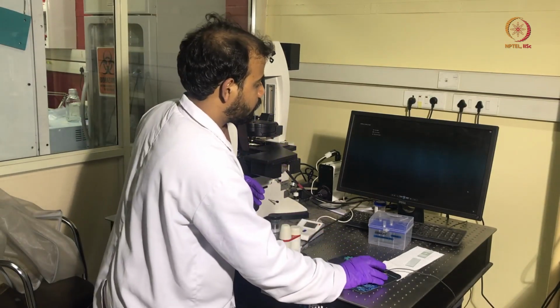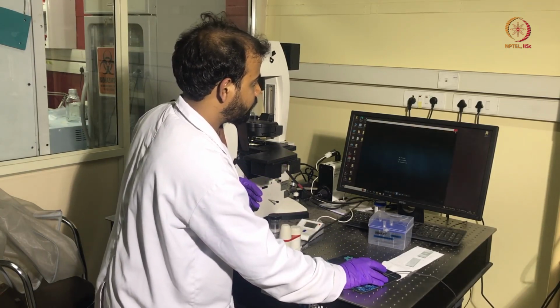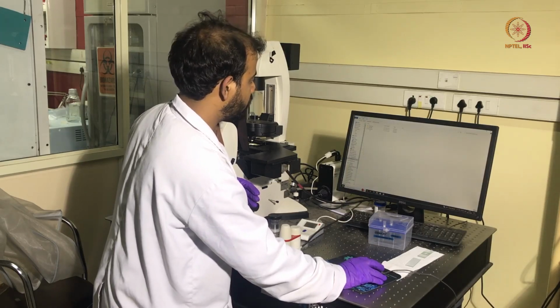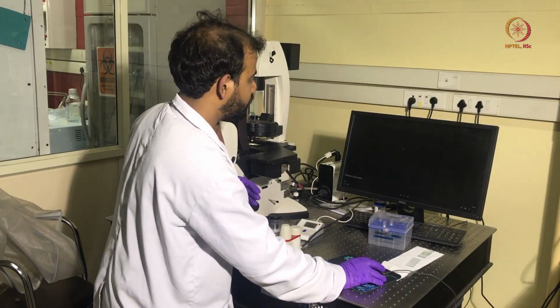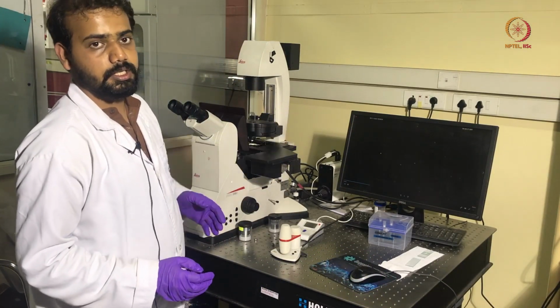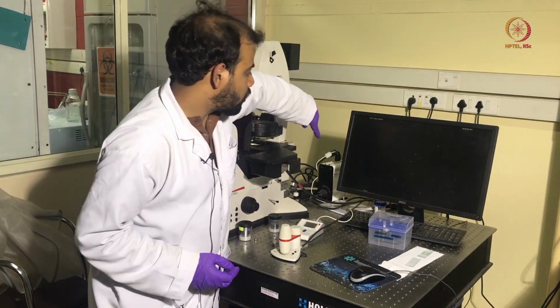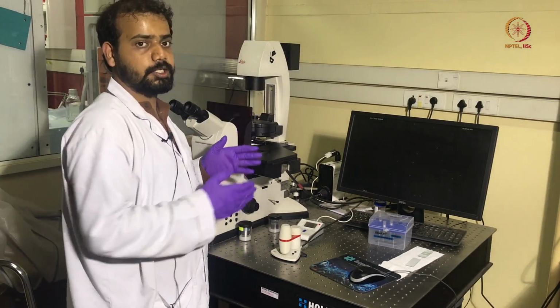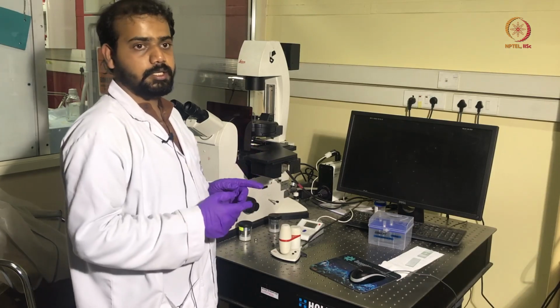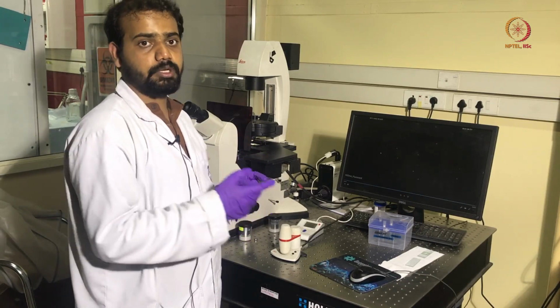And now we will move towards the third technique, which is fluorescence microscopy. Here again the white dots are the Brownian particles. In fluorescence microscopy, this is the white light source which we will turn on, and we will allow the white light to pass through the dichroic mirror which we saw earlier in the filter cube turret. For these particles, we are using the rhodamine filter cube, which consists of a dichroic mirror.